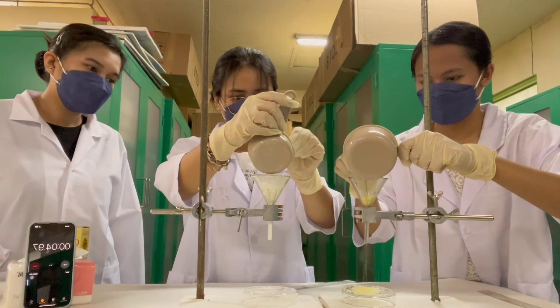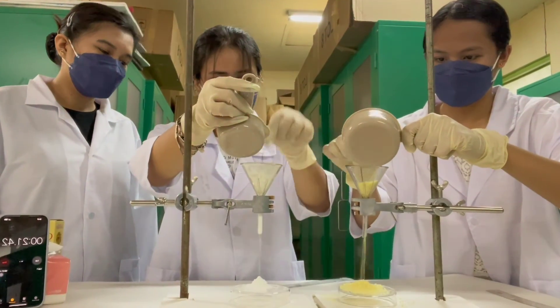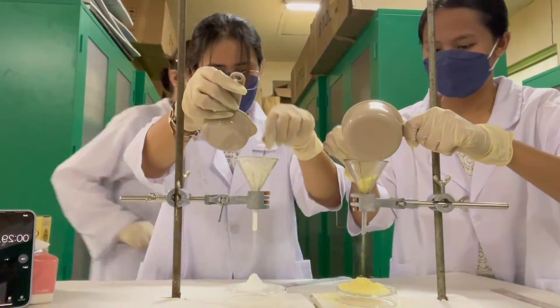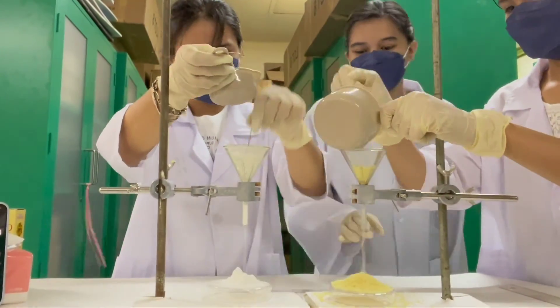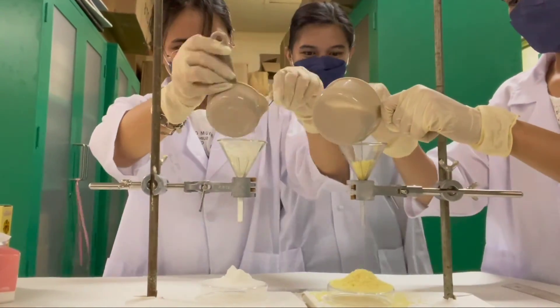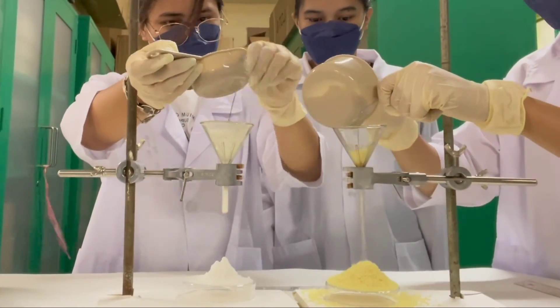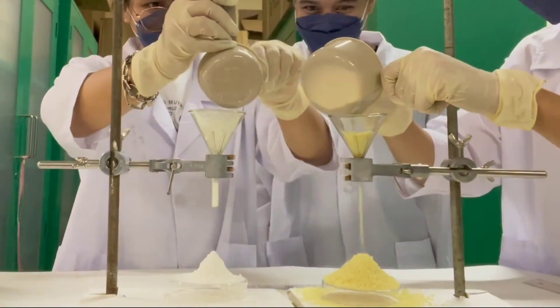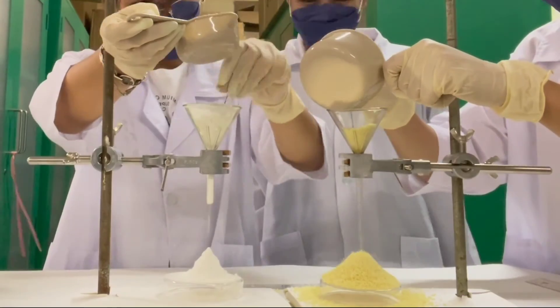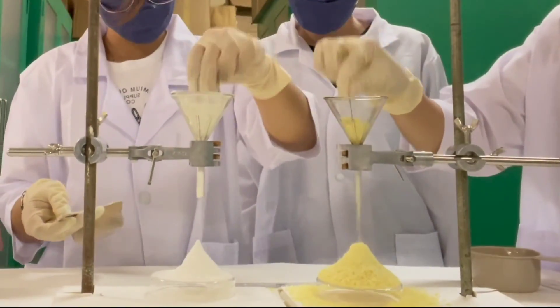In this experiment we observed that the granules formed the pyramid faster, in about two minutes, but the height of the pyramid was shorter at about 3.5 centimeters. The powder formed the pyramid much longer, in about seven minutes, but the height formed was five centimeters, which is taller than the height of the granules pyramid.